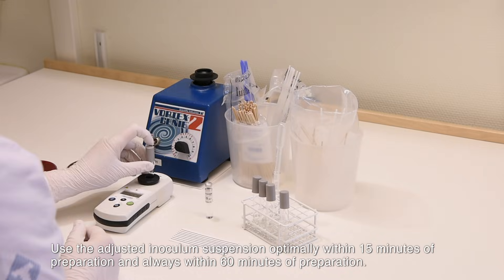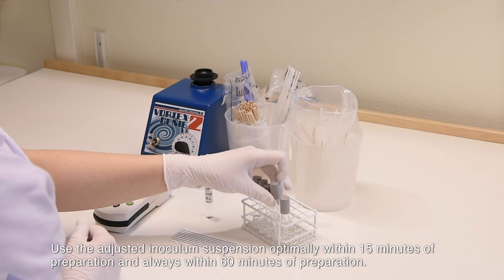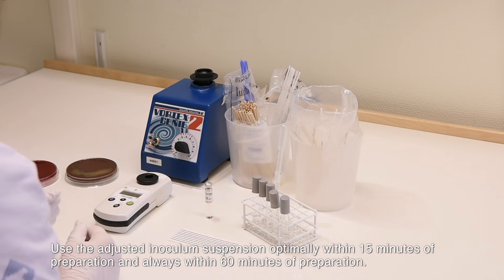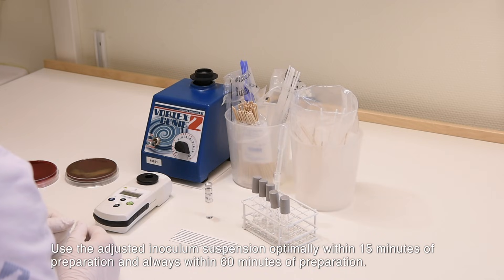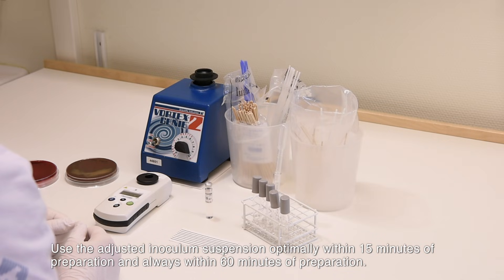Use the adjusted inoculum suspension optimally within 15 minutes of preparation, and always within 60 minutes of preparation.